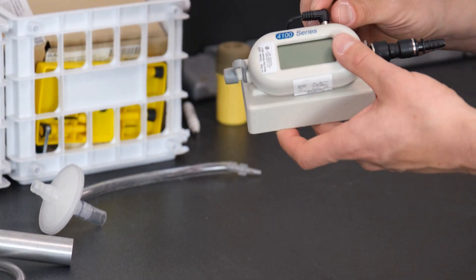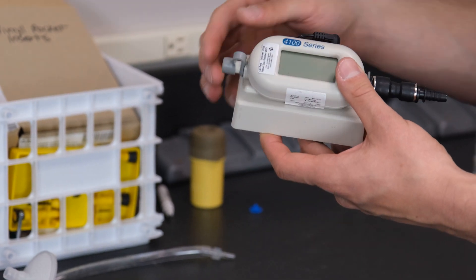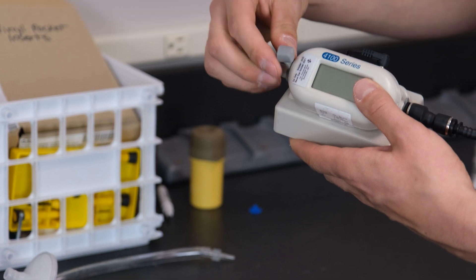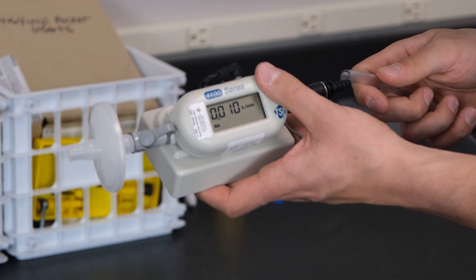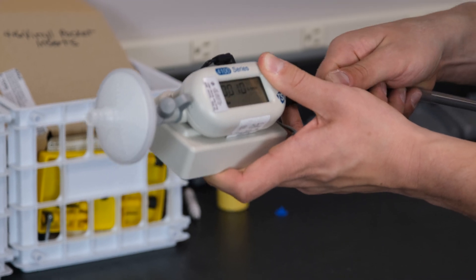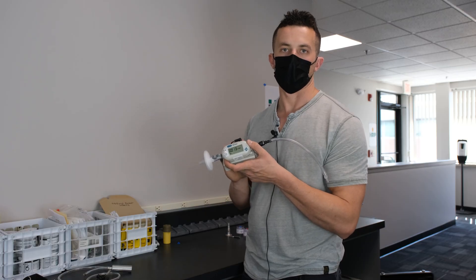To start, we're going to get our 4100 series calibrator going. I'm going to plug in the power button — I like to keep it unplugged so it doesn't drain the battery. Put our dust screen on, turn on the machine, and then plug in our Tygon tube to the adapter with the appropriate media adapter on that end so we can begin our calibration process.